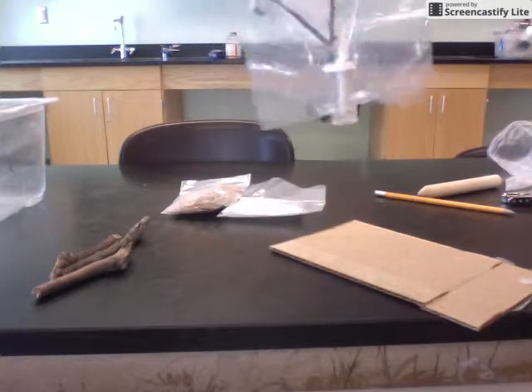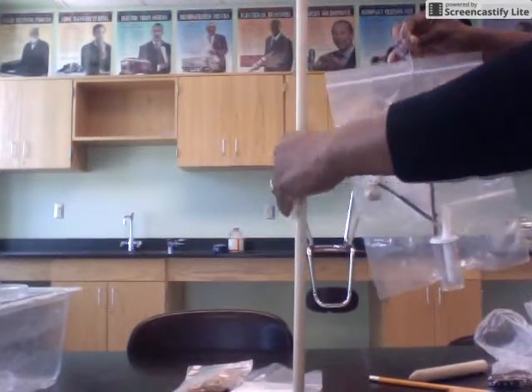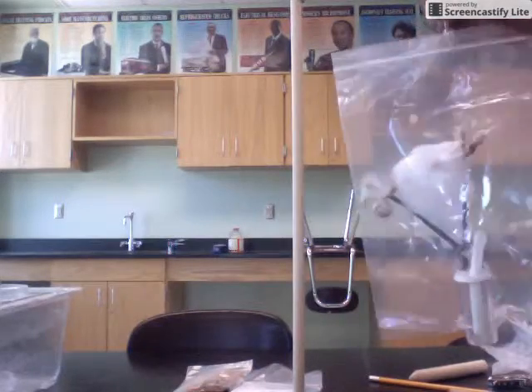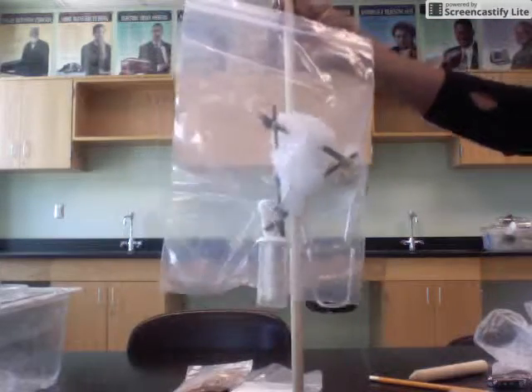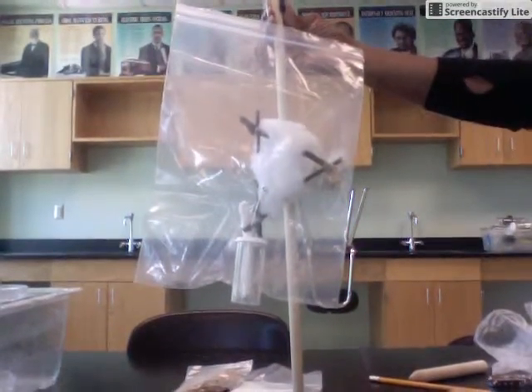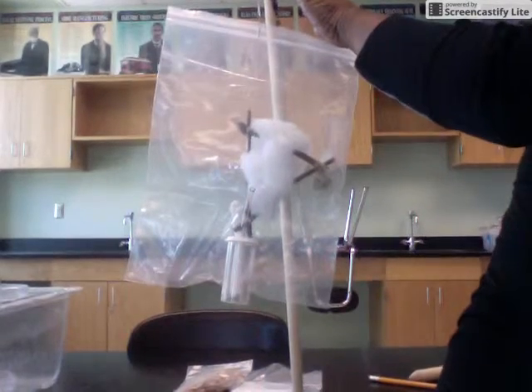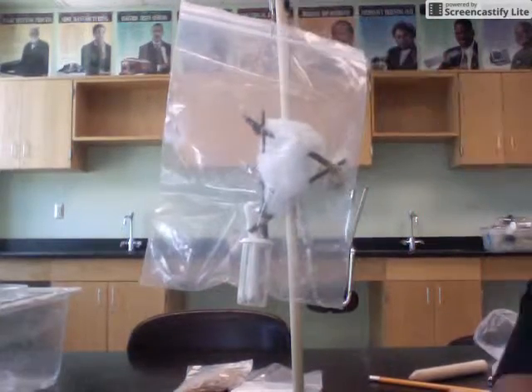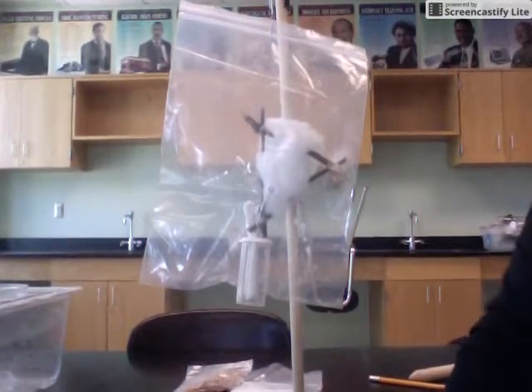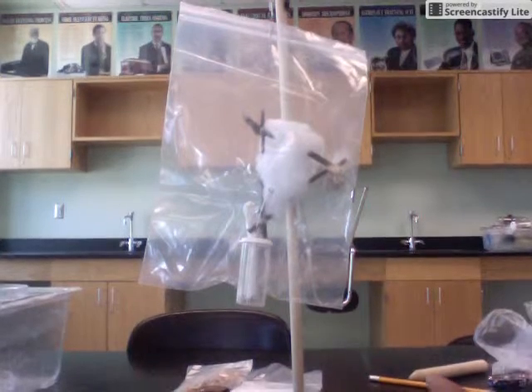When students are making their observations, we use a dowel on a stand, constructed using a binder clip. Open it up and position it so students can hook their bags on and make their observations. I make four copies of an observation diagram per page for students to use in recording their data.